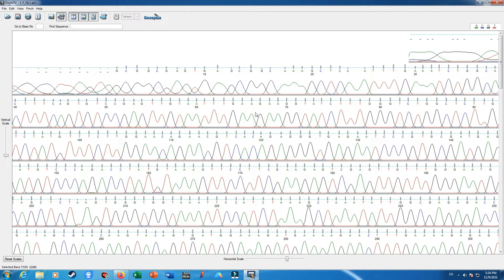Oh, here is another result, with a higher intensity of fluorescent dye in here. As you can see, the adenine peaks mask each other and are not separated from each other. You should decide which is which; there are three adenines here, and also, as you can see, the distance between cytosine and adenine is quite long. There might be one or two adenines here, and there might be another nucleotide masked behind the adenine intensity, which is very high. Some nucleotides might be masked by their lower intensities.